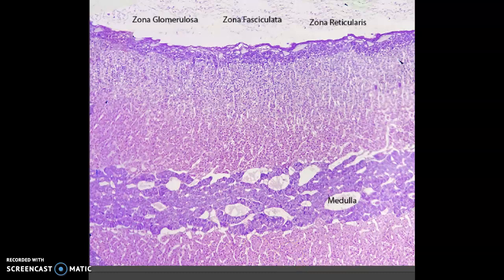So this was your adrenal gland slide, and it's actually way better than what we had before. The problem is that the zona reticularis right here and the zona fasciculata right here are very similar in color. And it's a three-dimensional one. So this was somebody's image they posted on the discussion, and I cropped it down here.